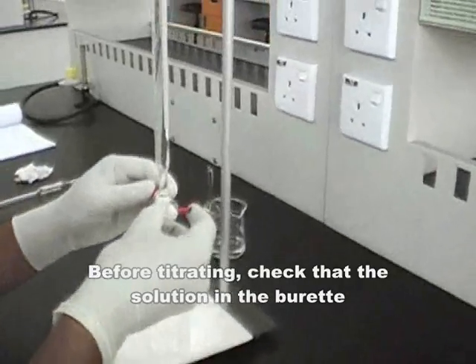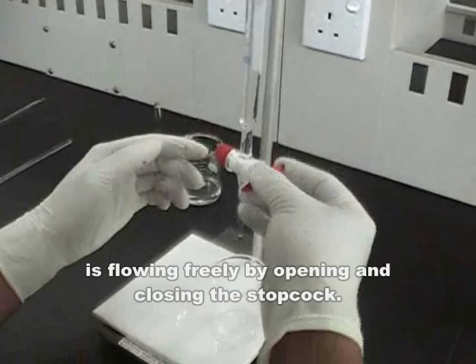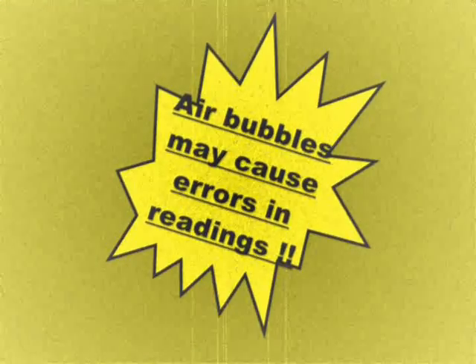Before titrating, check that the solution in the burette is flowing freely by opening and closing the stopcock. Check the tip of the burette for air bubbles. If there are air bubbles, remove them by tapping gently the side of the tip of the burette while allowing the solution to flow. Air bubbles may cause errors in readings if they are not removed.